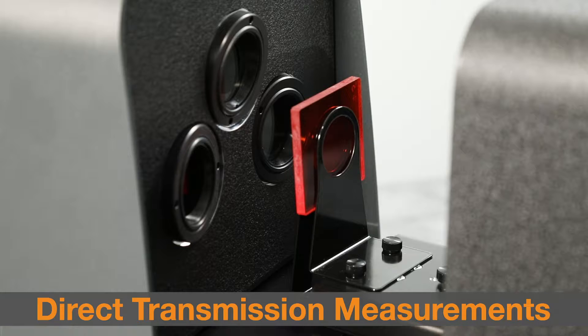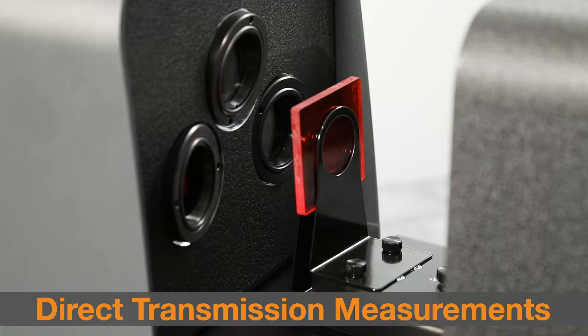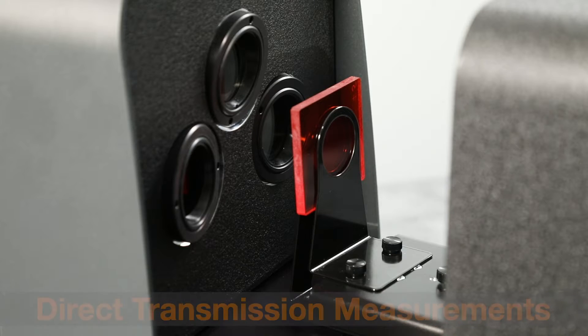When performing direct transmission measurements, only the 25mm clamp, stop, and aperture plate should be used.